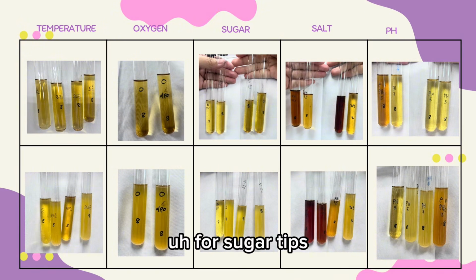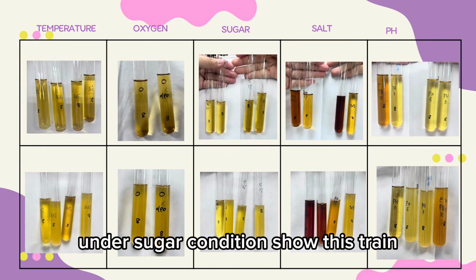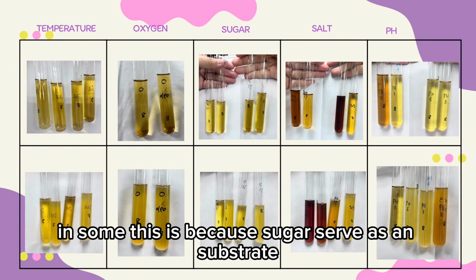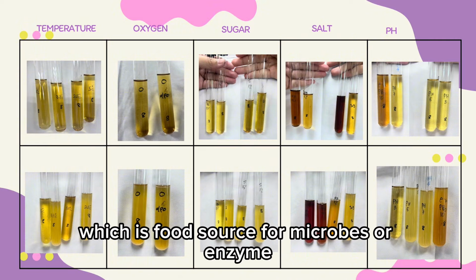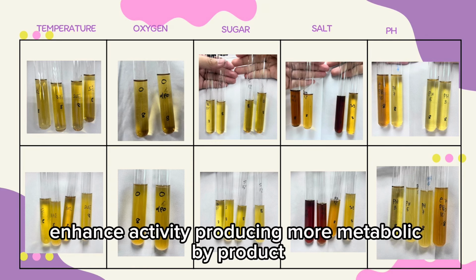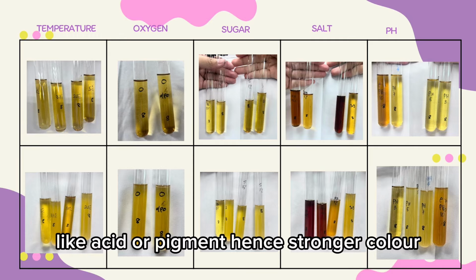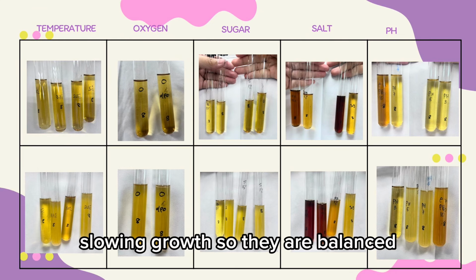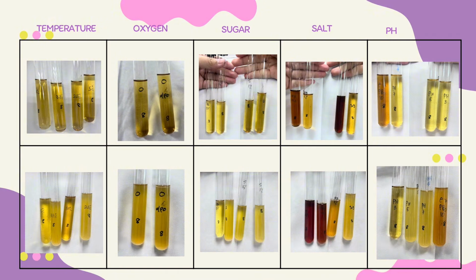For sugar, tubes under sugar conditions show distinct color change with a darker tone in some. This is because sugar serves as a substrate, which is a food source for microbes or enzymes. Higher sugar concentrations usually enhance activity, producing more metabolic byproducts like acid or pigment, hence stronger color. Extremely high sugar can also cause osmotic stress, slowing growth, so they are balanced.